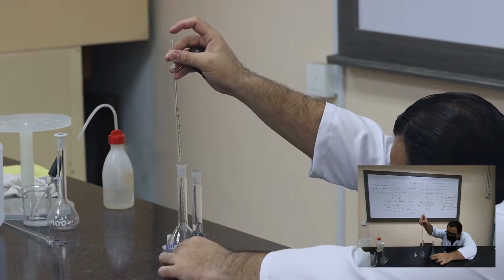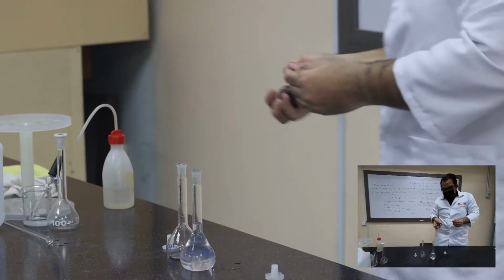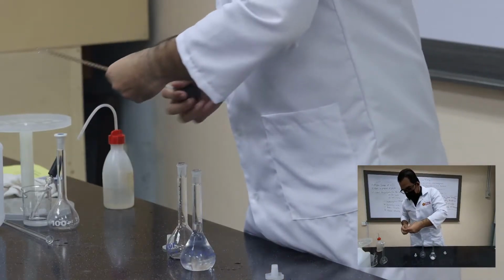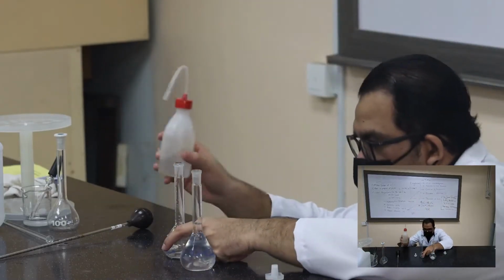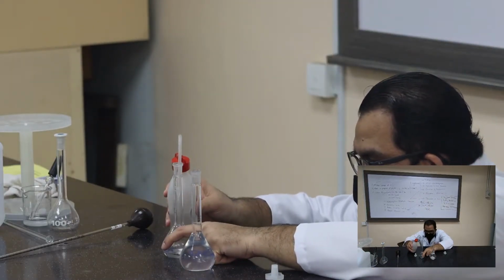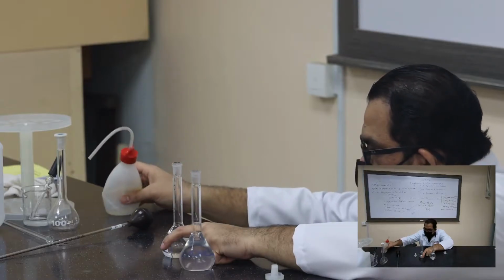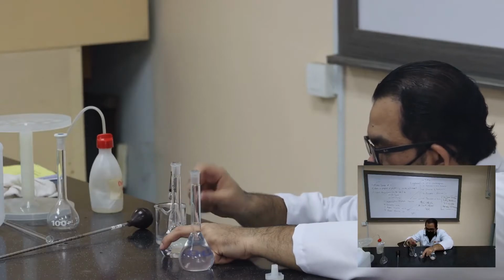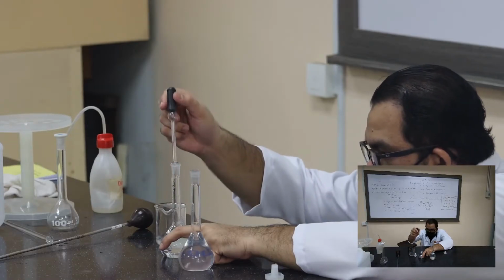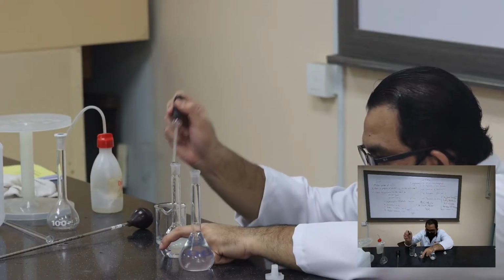Well, you have to calculate that. I'm not going to tell you the amount. M1V1 equals M2V2, guys. Since I have already transferred a certain amount of the stock solution into the next volumetric flask, now I'm going to fill up the volumetric flask with distilled water right up to the mark, the same process that I demonstrated earlier. So upon attaining the mark, I should be able to get my 10 ppm working solution of zinc.